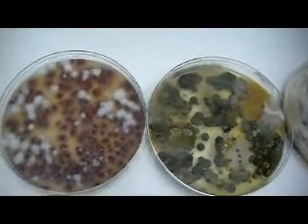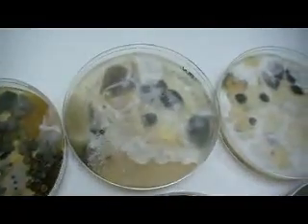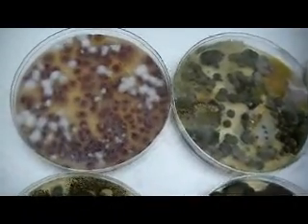These are different types of molds grown in agar media in a laboratory. They are from samples collected from indoor environments. As you can see, molds come in different colors — some appear reddish, some appear white, others may look black or gray.